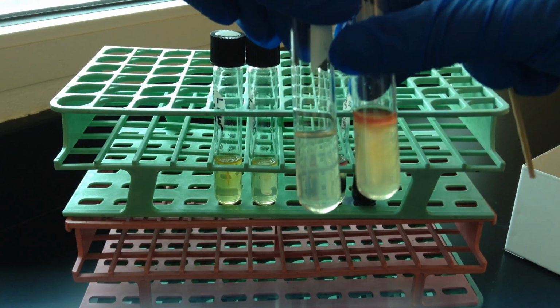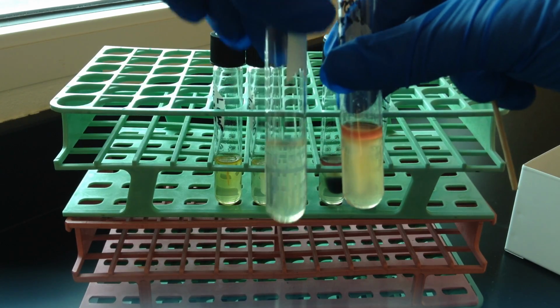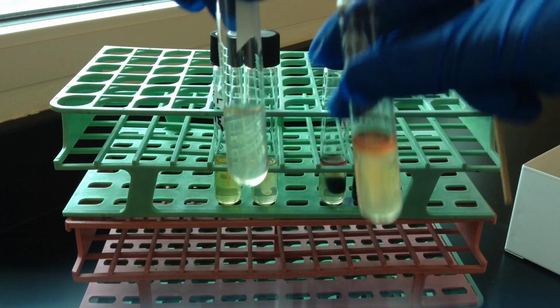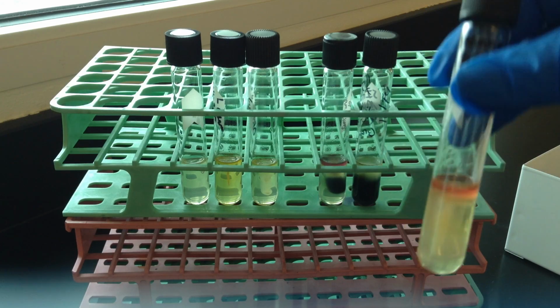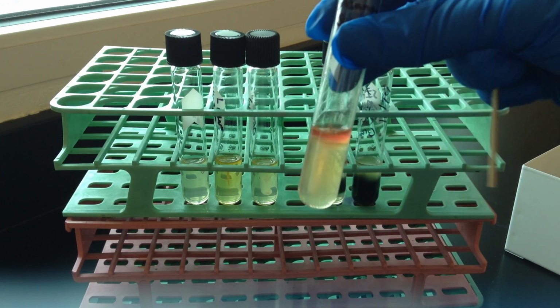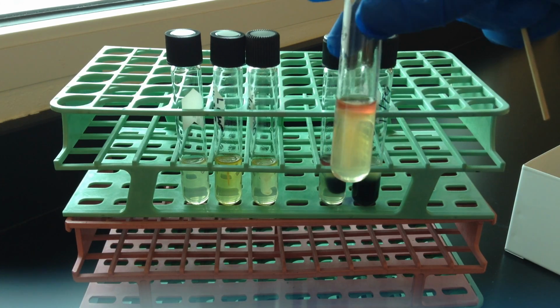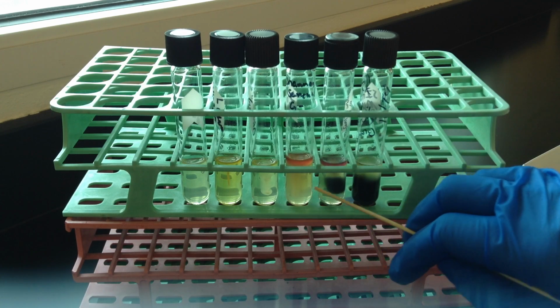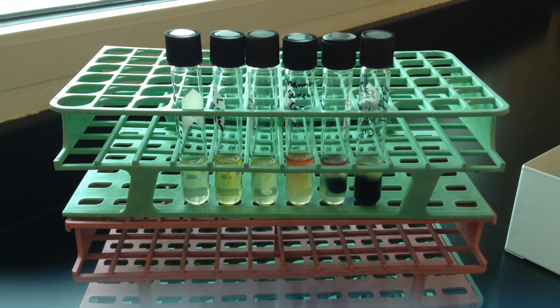Another nice way to get that comparison is an uninoculated tube, here I'm showing on the left, and compare that to how clear that is all the way through versus one that's truly cloudy. And this would indicate that the organism possesses one or more flagella, and it's able to move away from where you inoculated it, so it moves away from that stab line. So all three of these here on the right, this one, and this one, would be considered motile organisms.